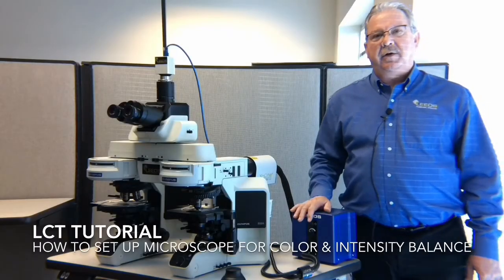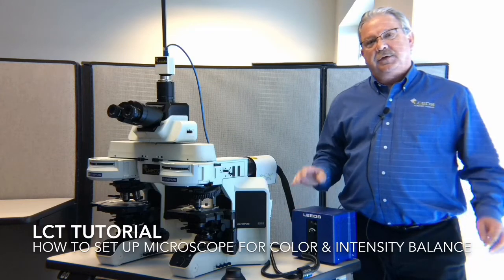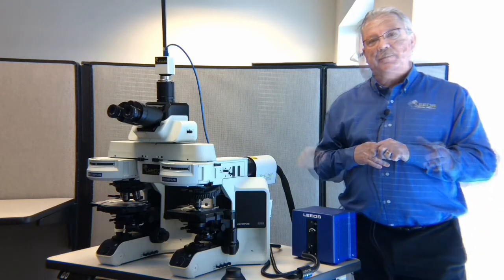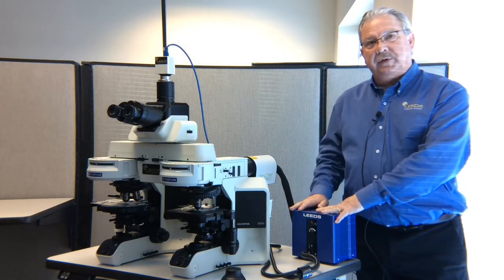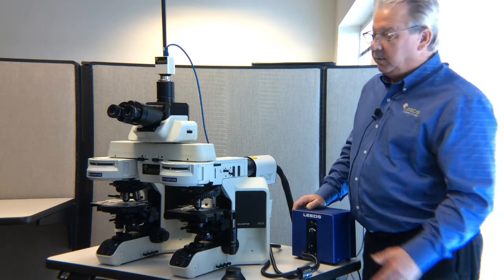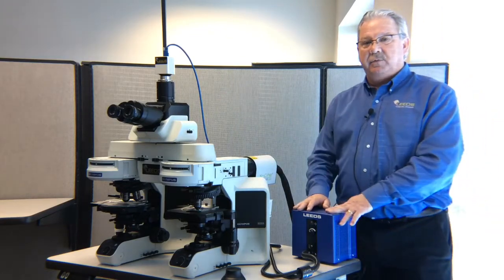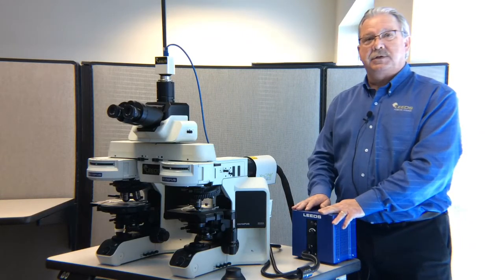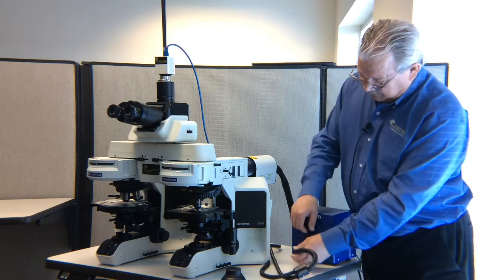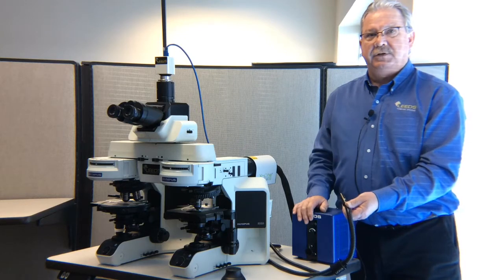Today we're going to talk about how to properly set up your LCT comparison microscope so that we achieve color balance and intensity balance in the microscope. We're going to start out with the light source and move our way through the illumination ray path of the microscope, up through the viewing ray path, so that we are able to look at the whole system and make sure everything's set correctly.